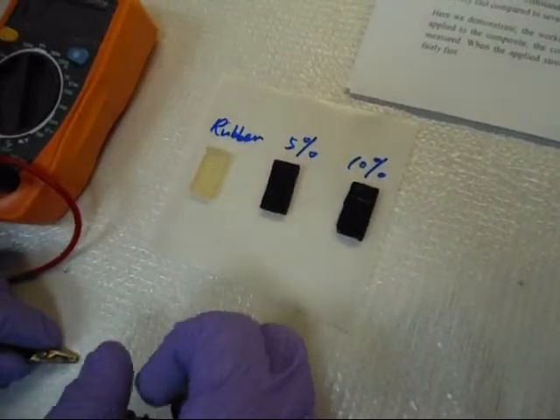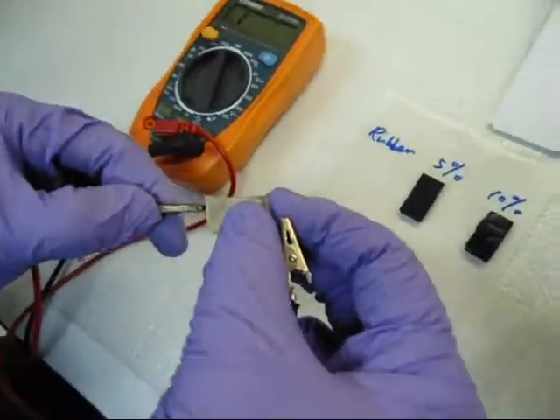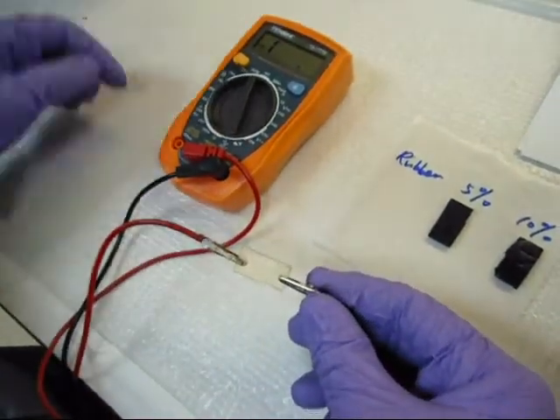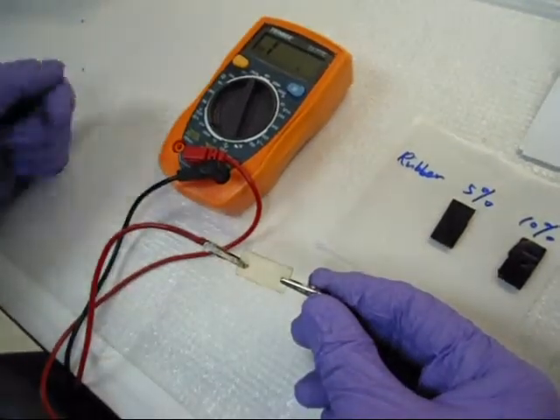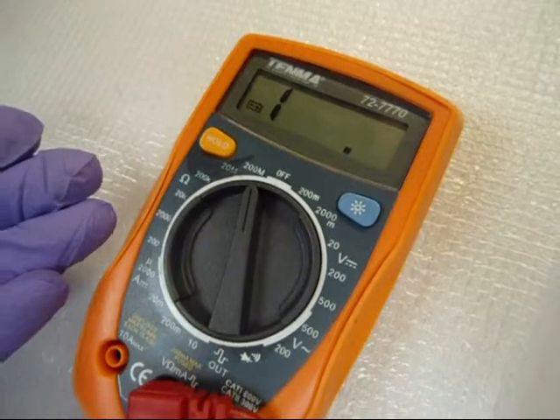As we know, intrinsic rubber is highly insulating. Now, we are going to test it. As we can see, the resistivity of this rubber bar is above the maximum value of the equipment.